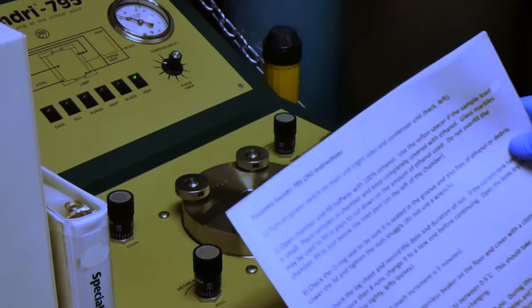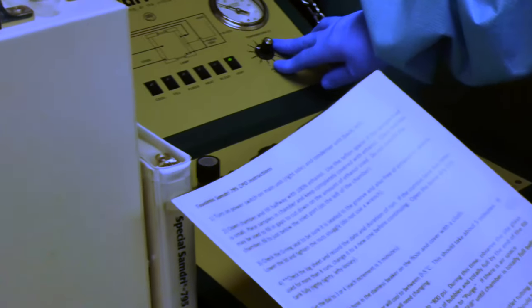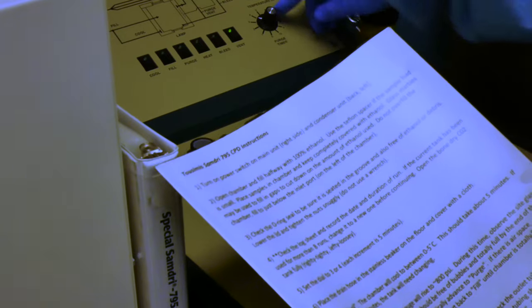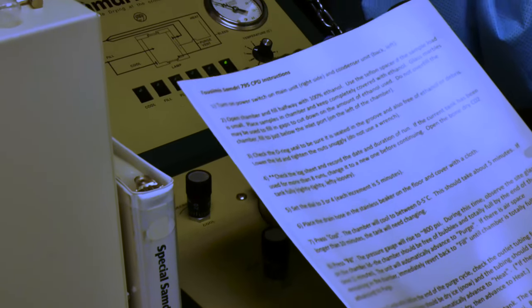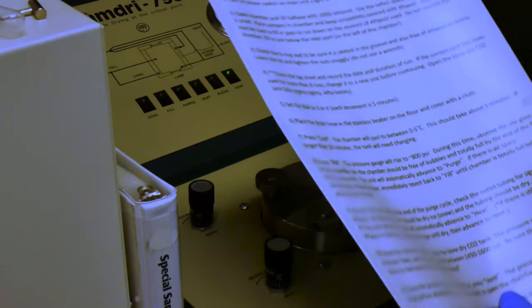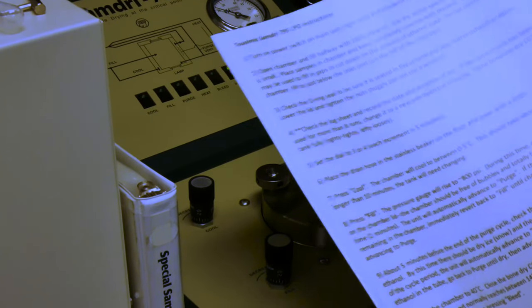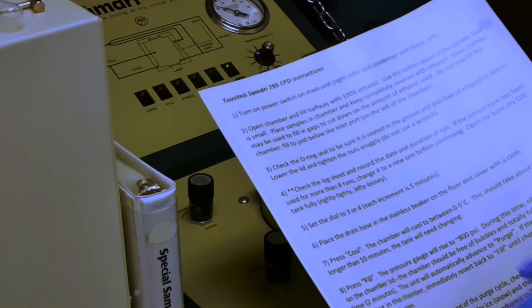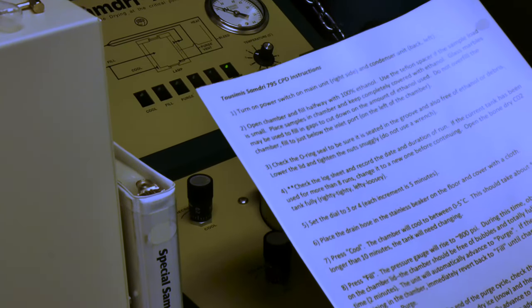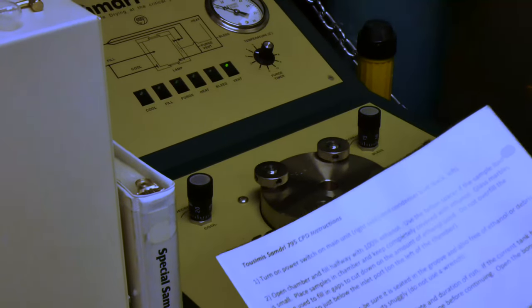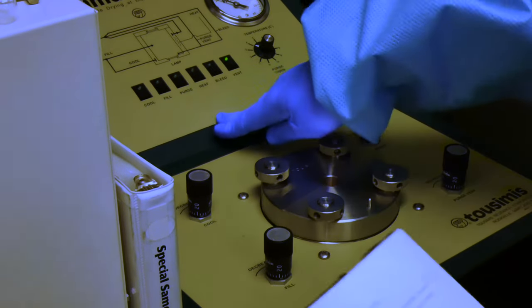We want to place the drain hose into the beaker to collect the ethanol as it's replaced with CO2 in the chamber. Based on our sample, we'll make a decision to use either three or four cycles for the purge. The more sample there is, such as a large piece of tissue, we opt for four. But if it's something minimal like cover slips, then we would choose something like three. If during the process, you can always extend the purge session in the middle. We have the drain hose in the beaker, we've got it covered with a cloth, and we'll advance the system to cool.